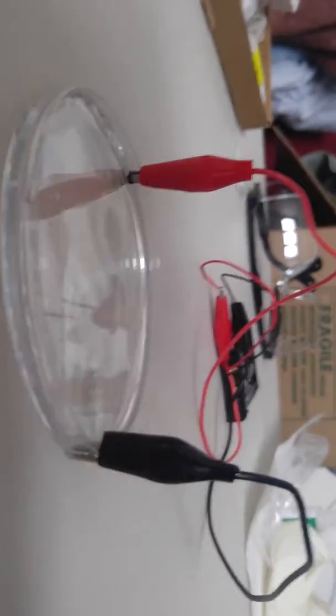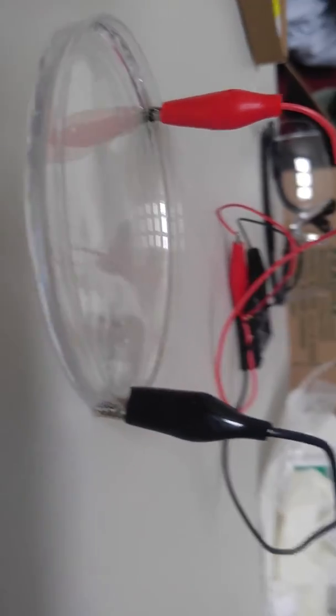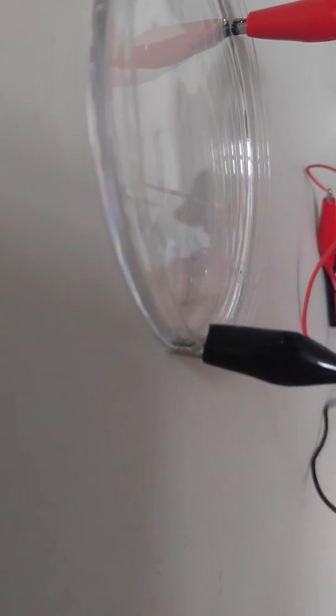How come it's only flowing from one side? I don't know. That's just the flow of electrons, and that's just the way it's happening. I'm looking at it. If you can see, it's not actually... Son, if I took the clip off, it would stop. The electricity would stop flowing, and the things would stop. Do you want me to do that? Push it down? No. No, watch what happens.